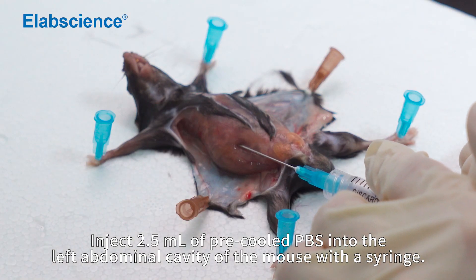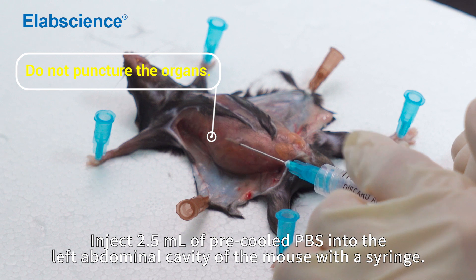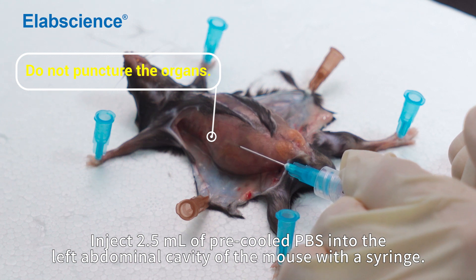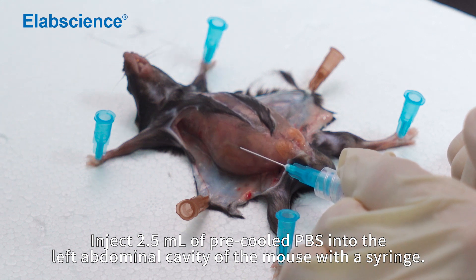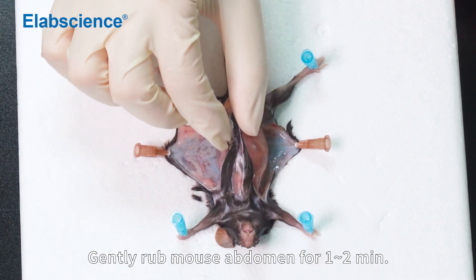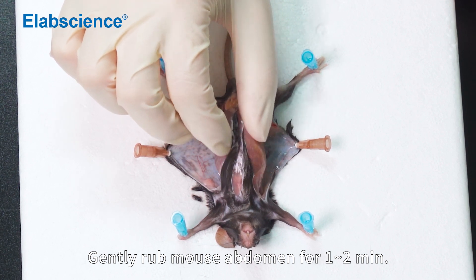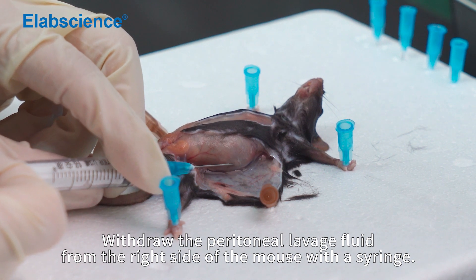Inject 2.5 ml of pre-cooled PBS into the left abdominal cavity of the mouse with a syringe. Gently rub the mouse abdomen for 1 to 2 minutes. Withdraw the peritoneal lavage fluid from the right side of the mouse with a syringe.